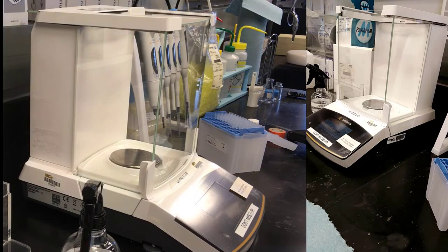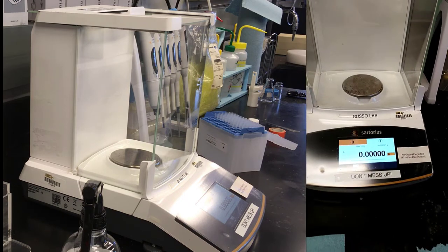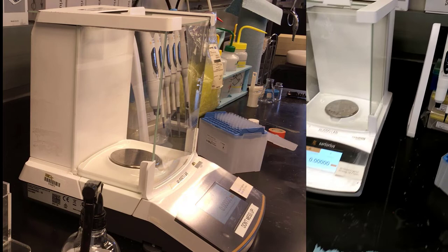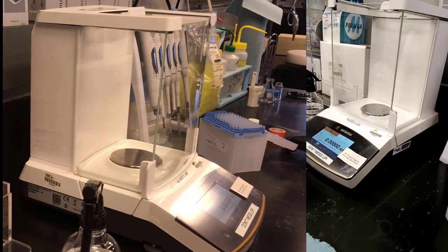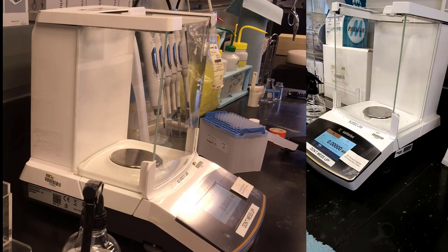I don't know if you can actually read the scale too clearly. When you get close to it, it lights up, and it's currently at zero. The guiding principle here for glove use and surfaces is that anything we touch should be clean enough to touch without gloves. But nevertheless, we often wear gloves.